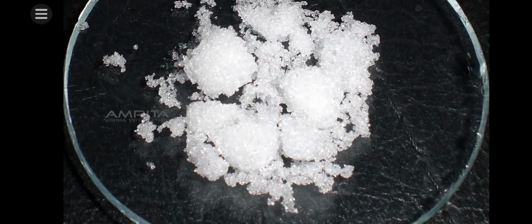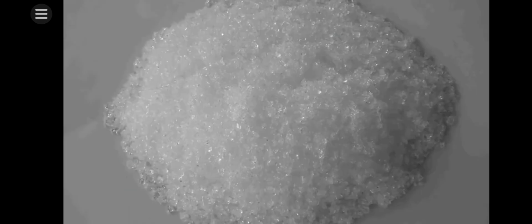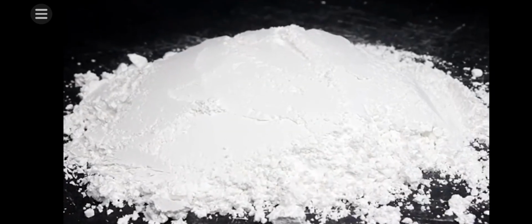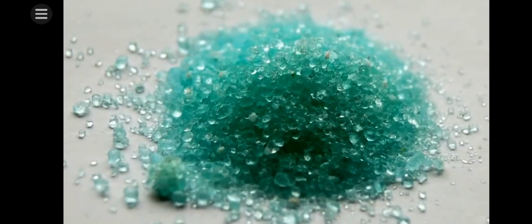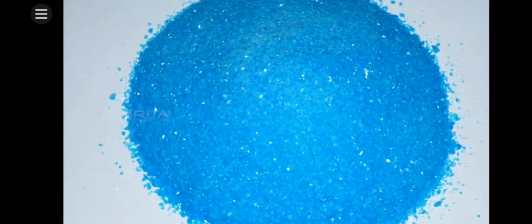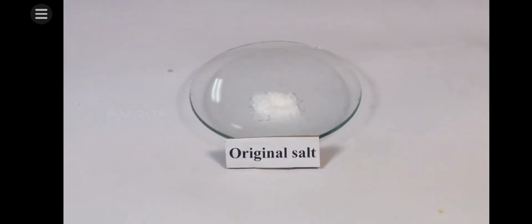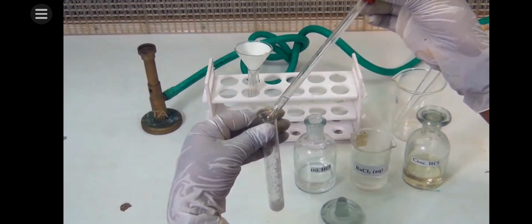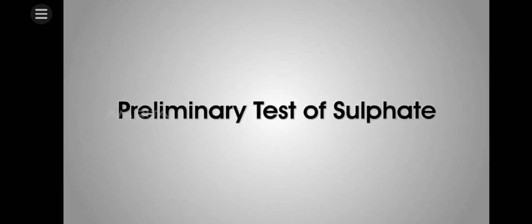Sulfate ion forms many salts like sodium sulfate, potassium sulfate, barium sulfate, etc. Very well-known colored salts of sulfate are green vitriol and blue vitriol. Our aim here is to test the presence of sulfate ion in a given salt. Let's look at the preliminary test of sulfate.